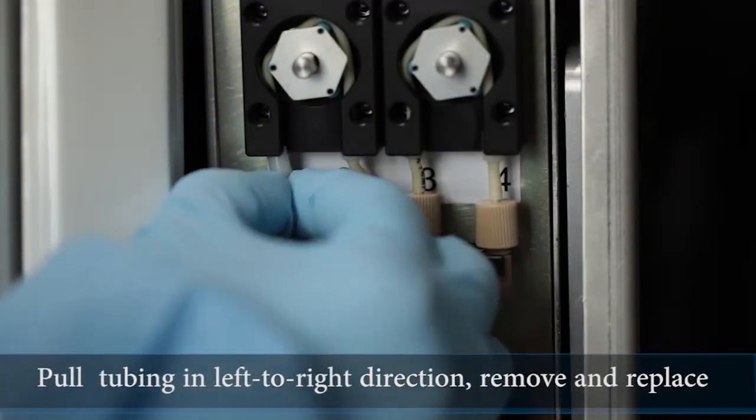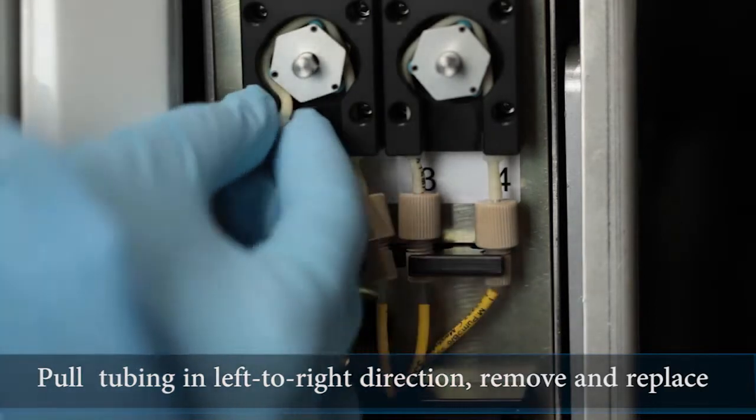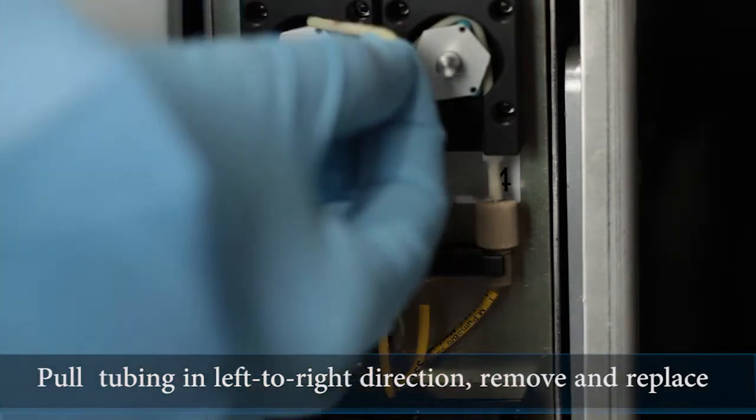Then pull the pump tubing in a left to right direction to gently remove the tubing from the pump housing for replacement.